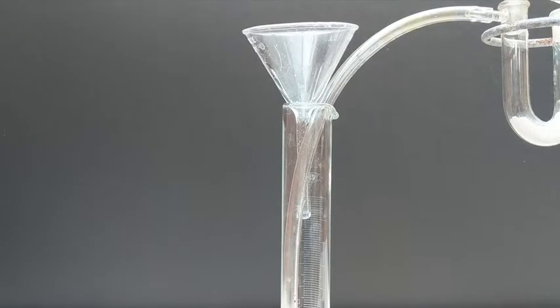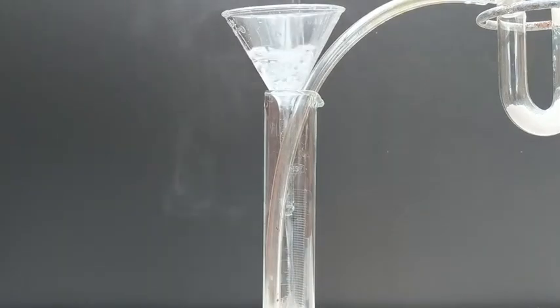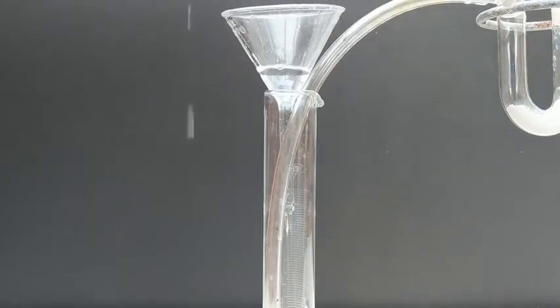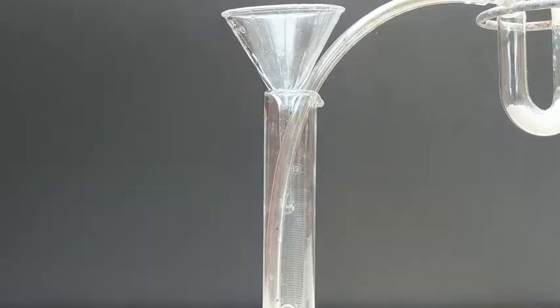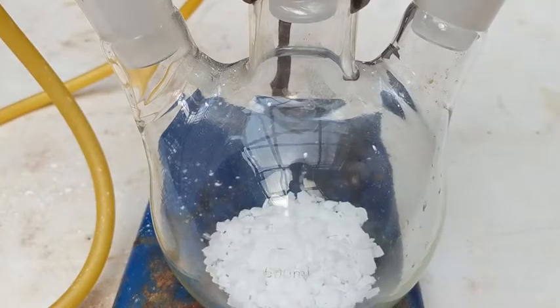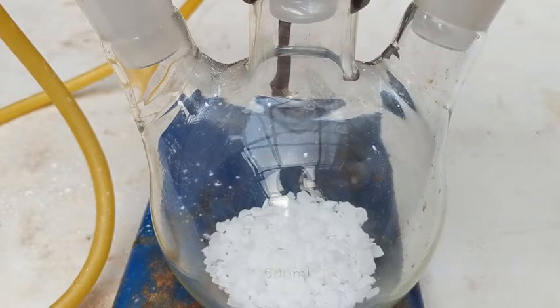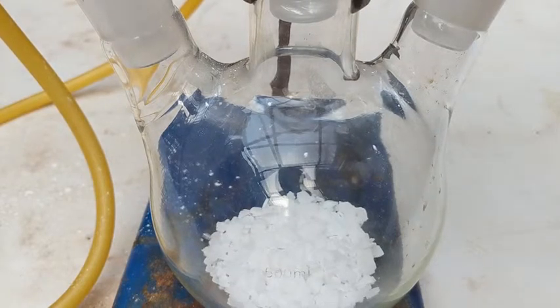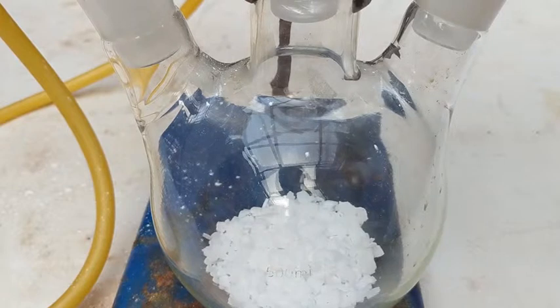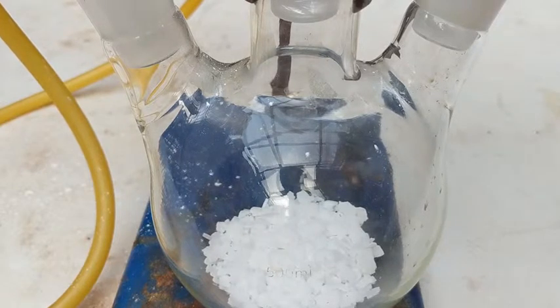And finally the glacial acetic acid. We wanted to add this last to minimize the amount of moisture in the air it is exposed to. Now let's get this reaction going. We want the rate of addition to be very slow to minimize the amount of water that is vaporized.